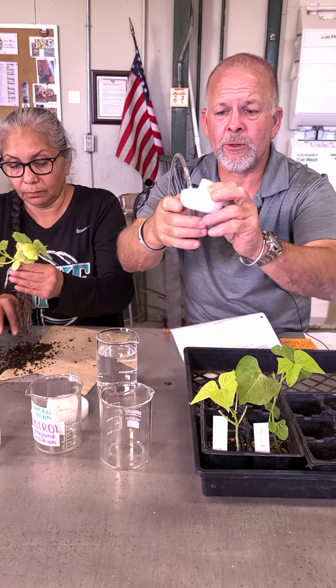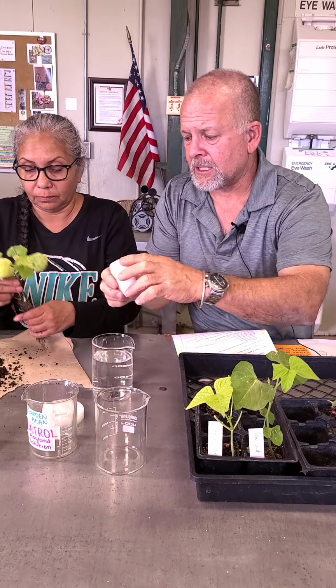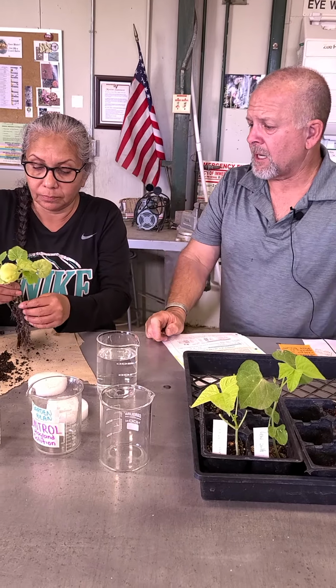So that's what we're doing. That's what this is for, and we'll hook those up. But right now, Belinda's gonna show you what she's done. You can see that she's getting the roots cleaned off.